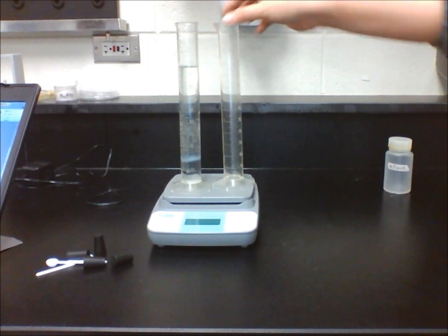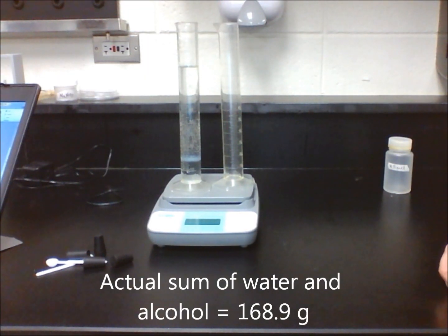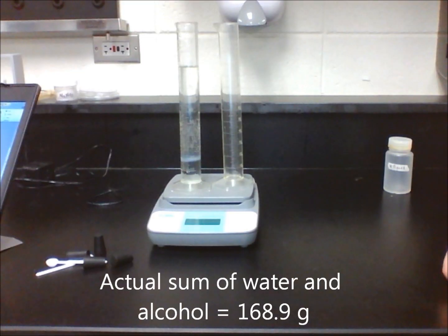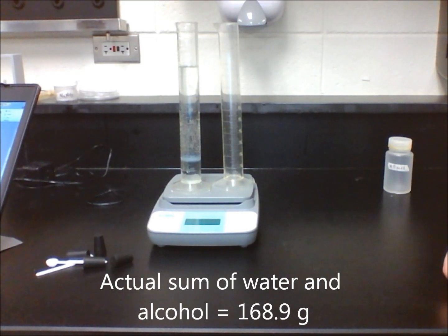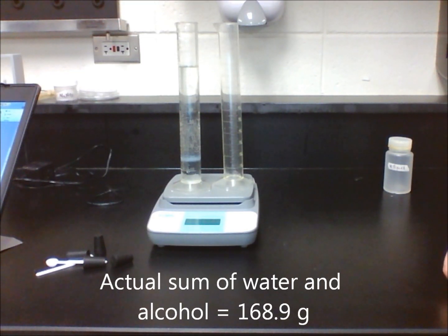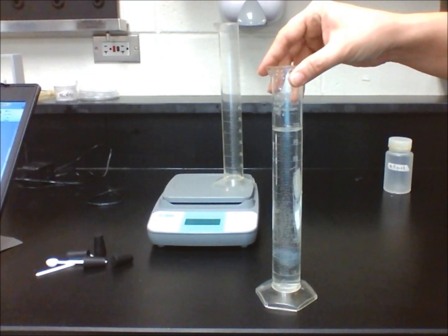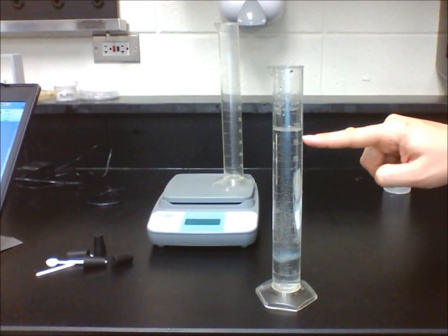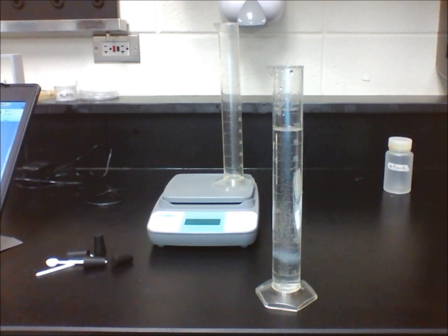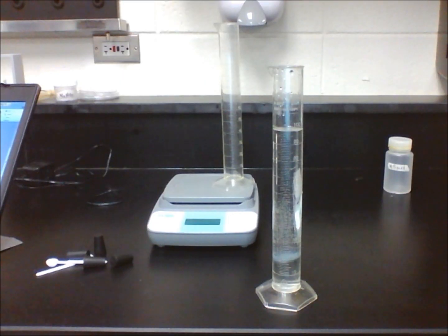You should notice that your volume is anywhere from 2 to 5 milliliters lower than your prediction, and that your mass should have stayed exactly the same. This shows that when the molecules are dissolved, they are reorganized, and this causes the volume to decrease.